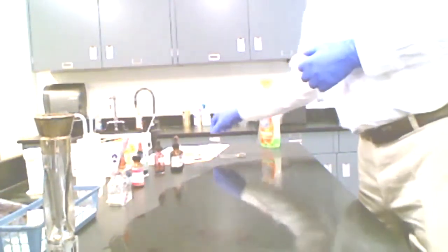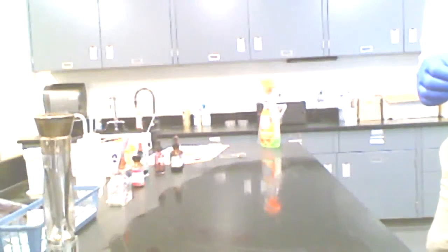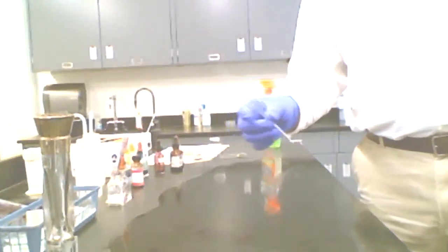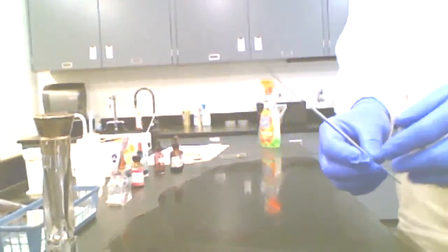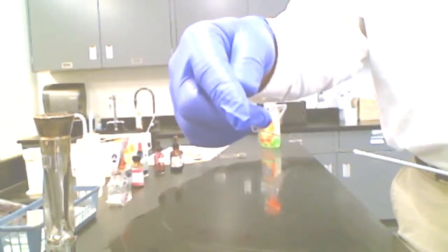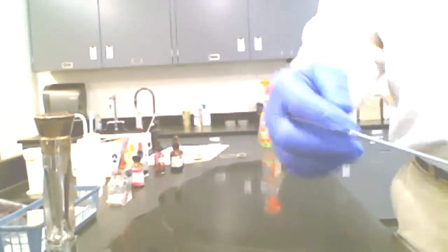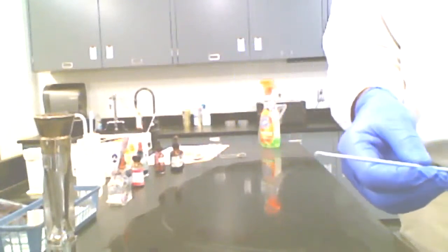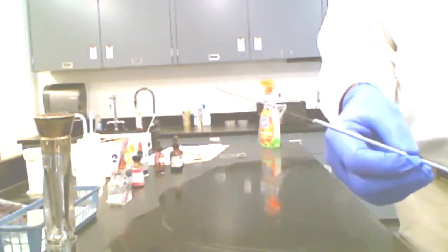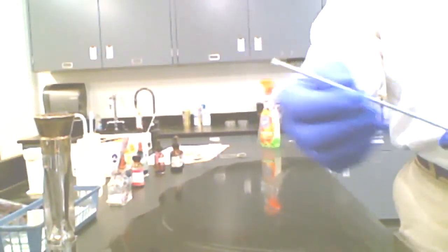The next step, since I'm going to be working with an organism, is to take my inoculating loop. That's an inoculating loop there. You can see it's got a wire that has a closed loop at the end. This is a wire known as nichrome. It's an alloy of nickel and chromium, and it's fairly resistant to destruction by heat. And then we've got this handle here. Now the handle is metal.